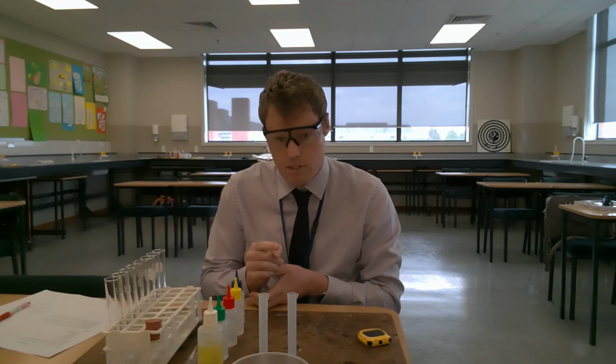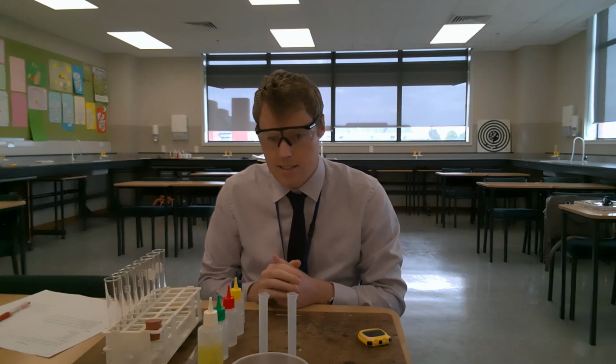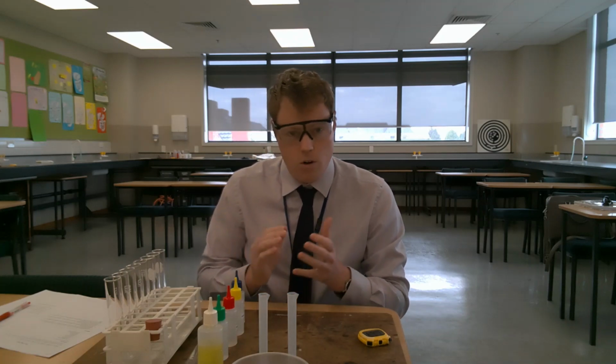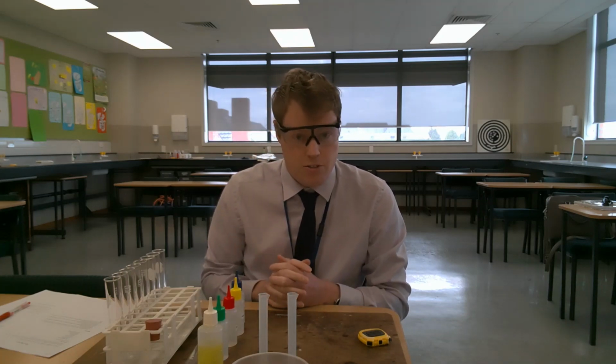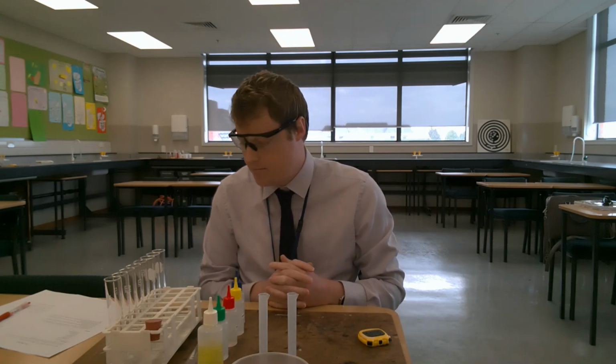One, to obtain the results you will be using to draw your tables and graphs and conduct your analysis. And secondly, watching this video will give you a clear sense of the strengths and weaknesses of the experimental method that you'll be commenting on later.